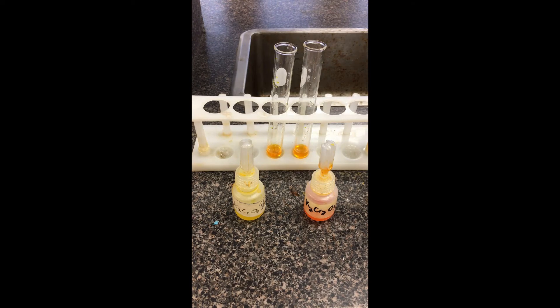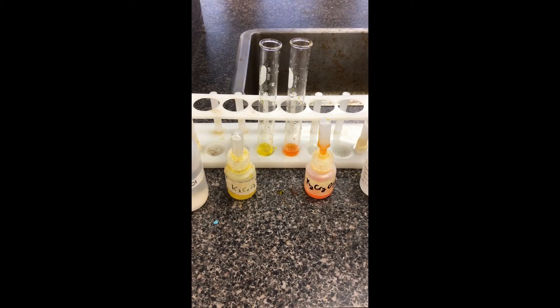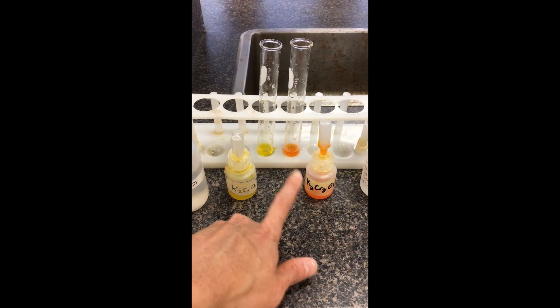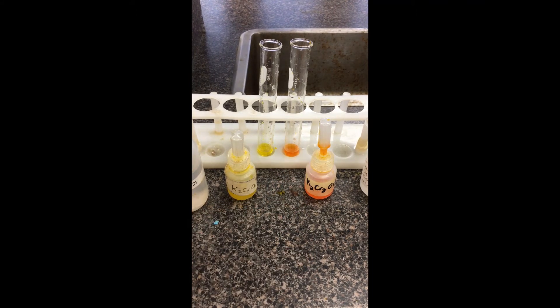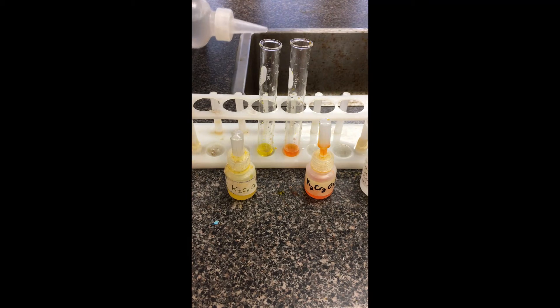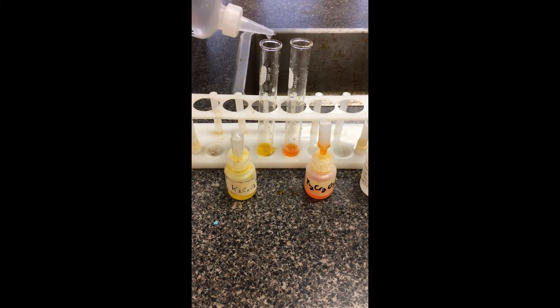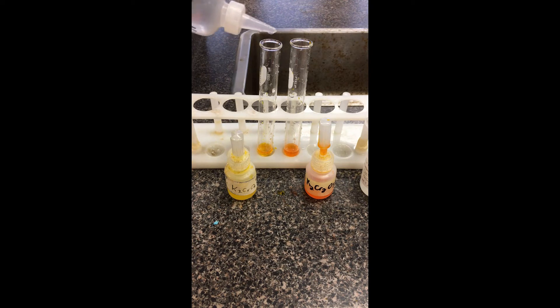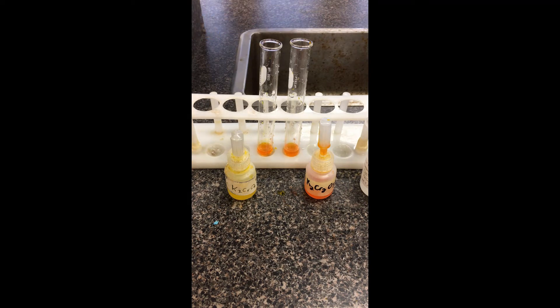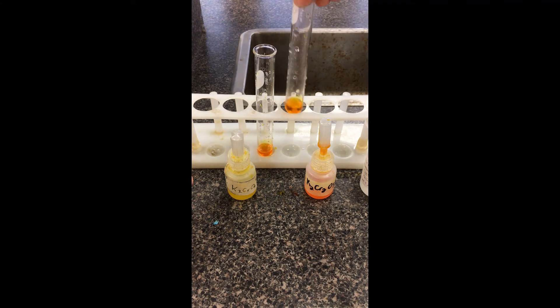So I'm going to reset here. This time I've again filled in the chromate, which starts as yellow, and the dichromate, which is orange. This time we're going to add the acid before adding the base — again, drop by drop to both of them — to see any potential color changes that might happen. The only difference is which ion I'm adding first. I should note that color change already.